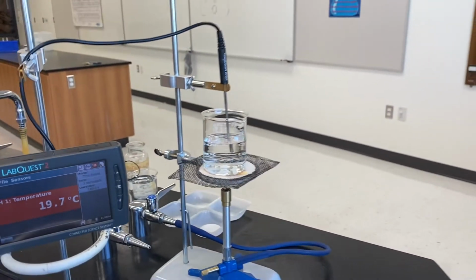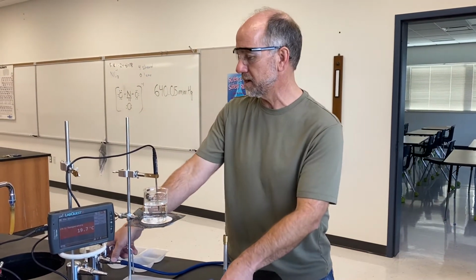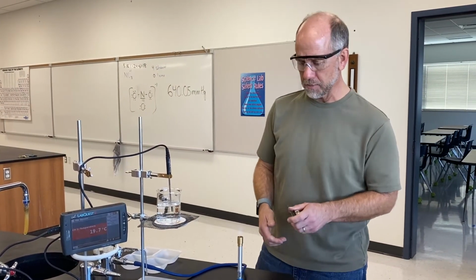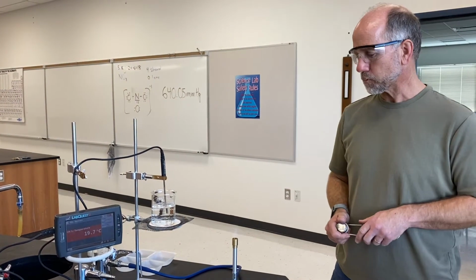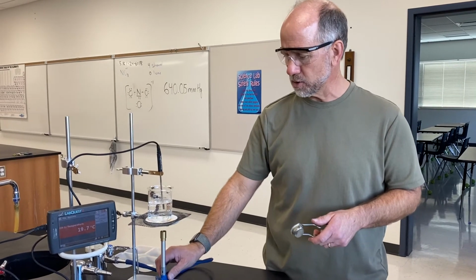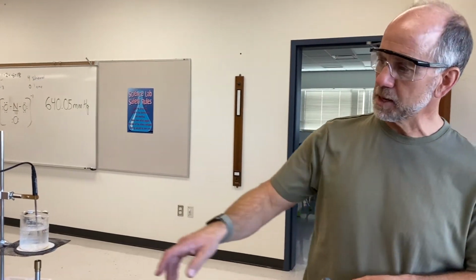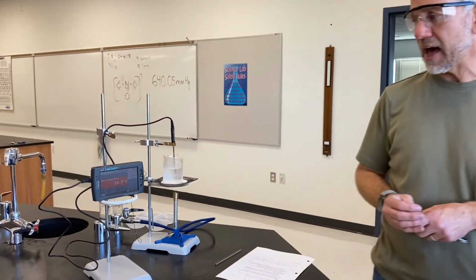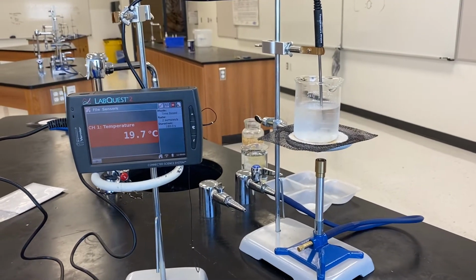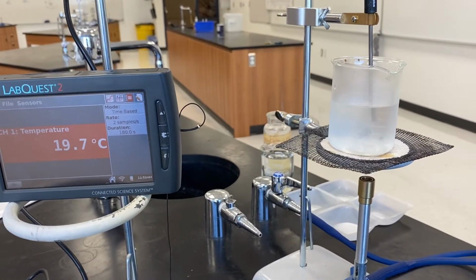Step 3, we've already set up our ring stands so that we're all ready to go. And what we're going to do now is begin heating our water. This is much like what we did in the last lab, where we were boiling water and measuring the temperature throughout. But this time the only data that we're going to collect is the temperature when the water starts to boil. We'll keep an eye on our thermometer here, and as it says in the lab, we'll record the temperature when it is constant for 2 minutes at 30-second intervals.